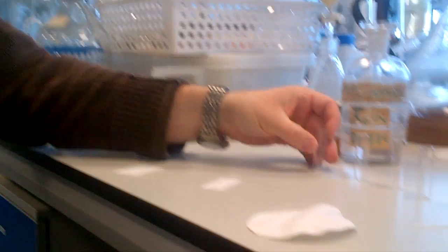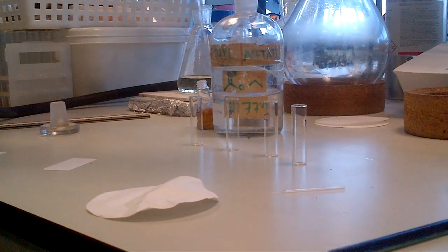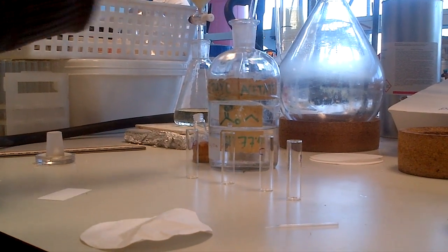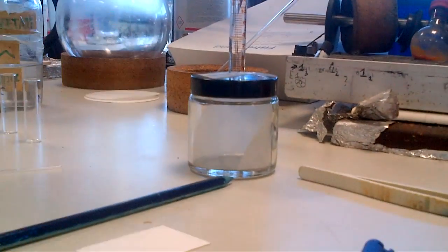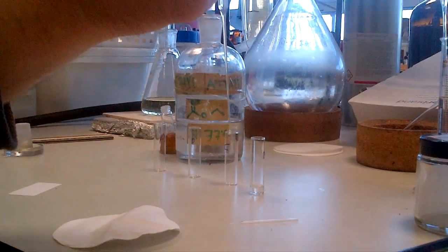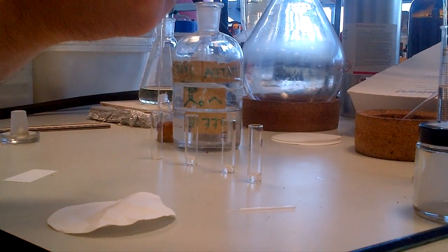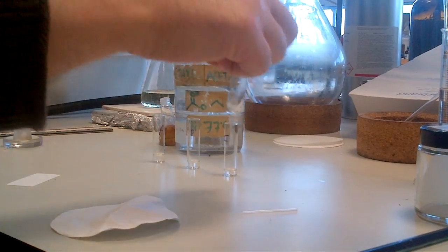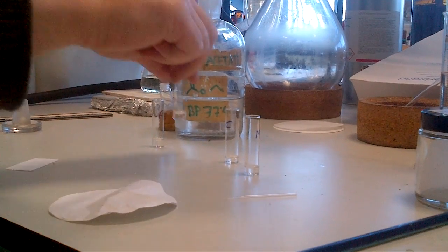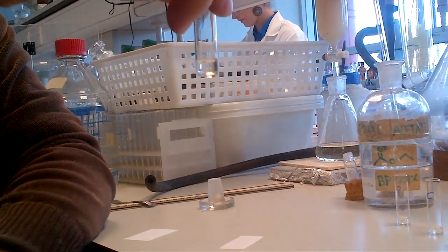All of the vials need to be diluted to the appropriate quantity with the solvent. In this case we're going to use ethyl acetate — you can also use ethanol, chloroform, or methanol. You can even use the same solvent you're using to run the tank. Take about 1 millilitre of ethyl acetate and add it to all of the vials. Then put the cap on the vial, invert, and give it a shake. We'll physically observe that the crystals have gone into solution.